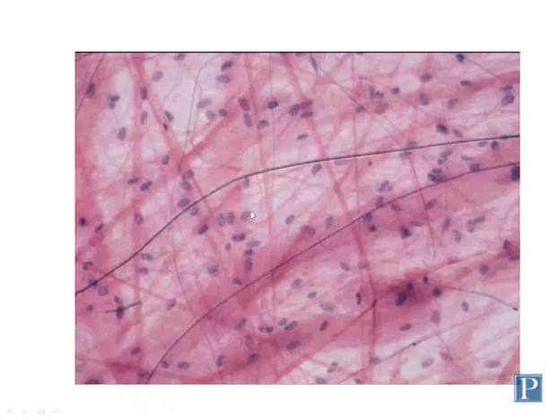Most of them are fibroblasts, but because you can't see the cytoplasm of the cells really well, it's very tough to distinguish between cells just based on the appearance of their nuclei. So assume that most of these are going to be fibroblasts. You can also see two major components of the extracellular matrix here. There are two major fibers.